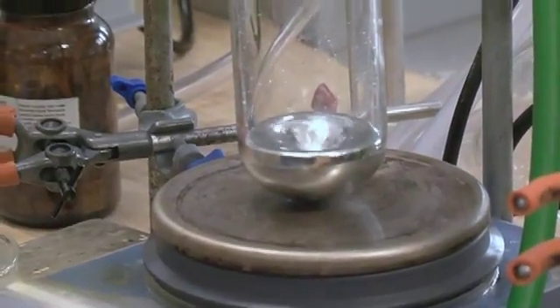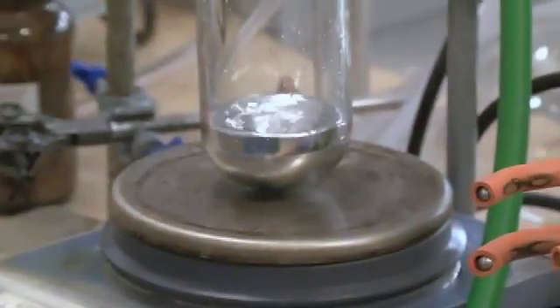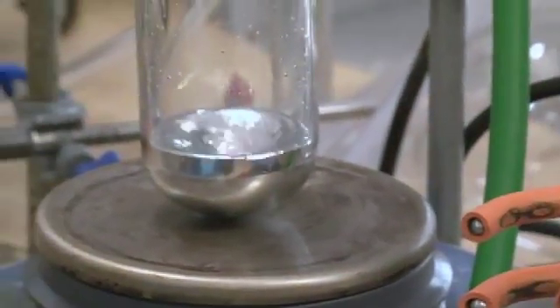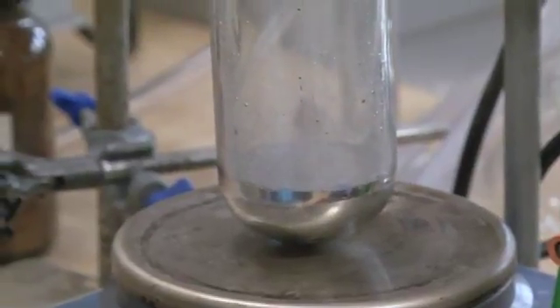With any luck, if I can get it in. There's always a little bit of worry. Will it dissolve? So there it is. If I stop it, that's it going in.